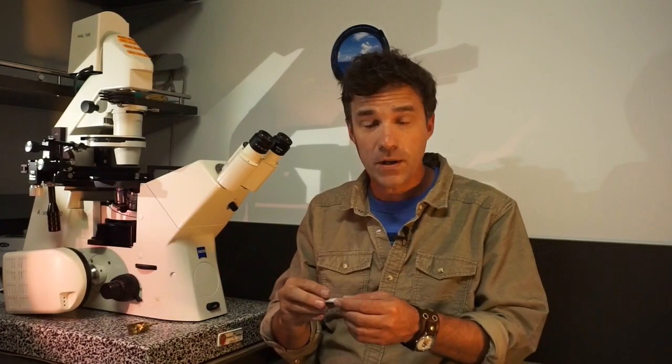Paper. So you can make your own paper microscope. The video takes about a minute and a half if you just follow along. All the instructions are there to show you how to do it yourself and how to mount a specimen, how to focus, and it's a lot of fun. So let's get down to it.